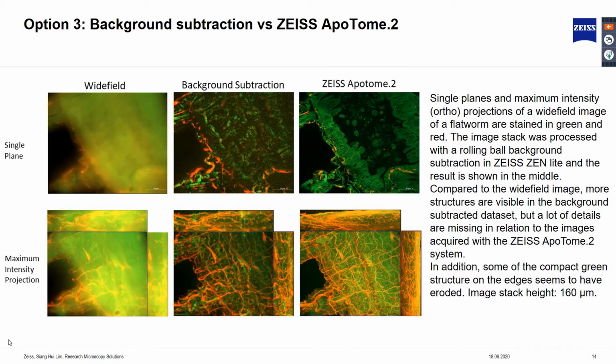Images shown in the middle column are processed with background subtraction. When you compare with the Widefield image, more structures are visible in this dataset. However, when you compare with the image from the apotome system, you will see that a lot of details are missing in the image obtained with the background subtraction. In addition, some of the compact green structures on the edges seem to have eroded.